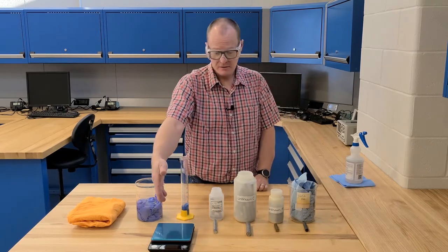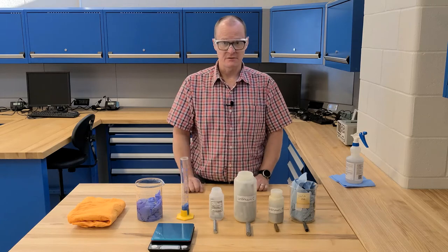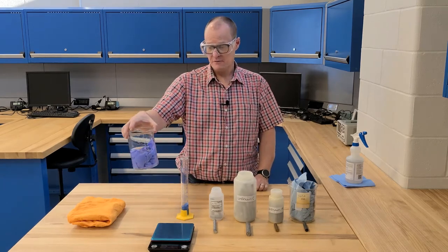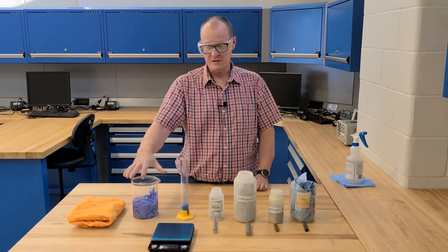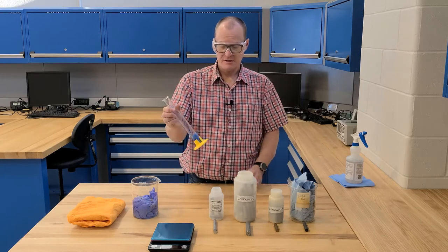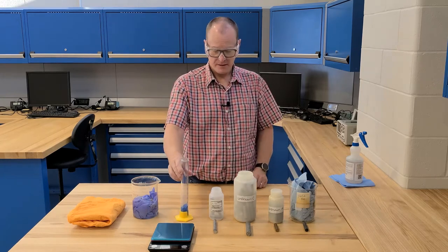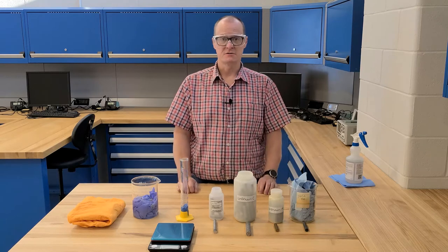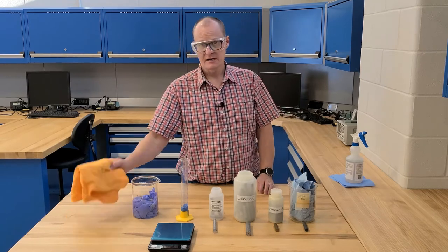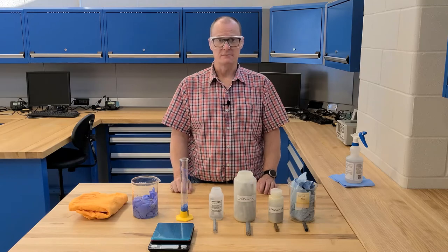You're going to need a scale to measure the masses of the various samples that you're working with. You're going to need a beaker full of water with a sponge at the bottom. You're also going to need a graduated cylinder with a sponge at the bottom. And then you're going to need various samples to work with. It's also a good idea to have a rag nearby in case you spill any water.